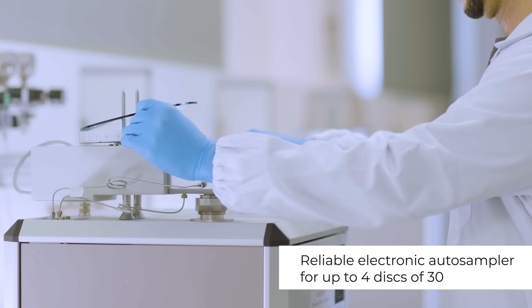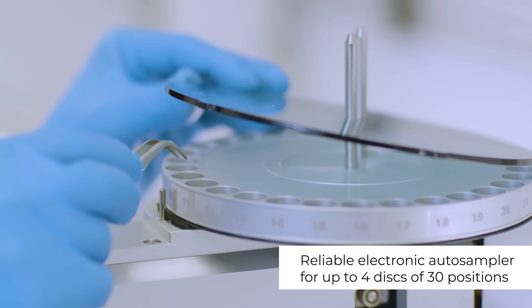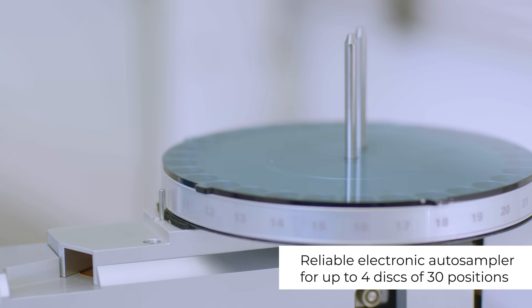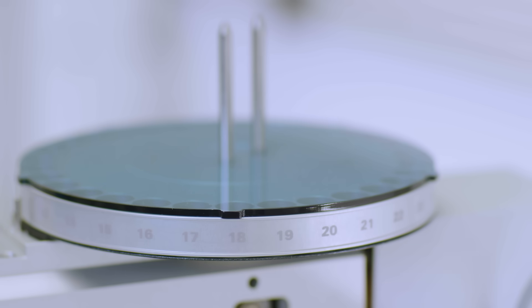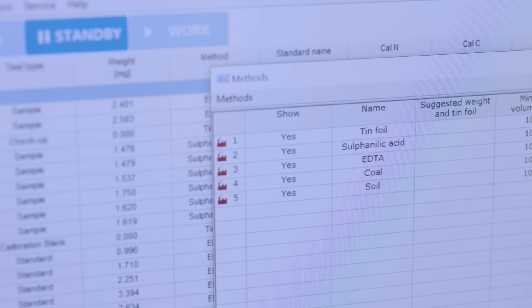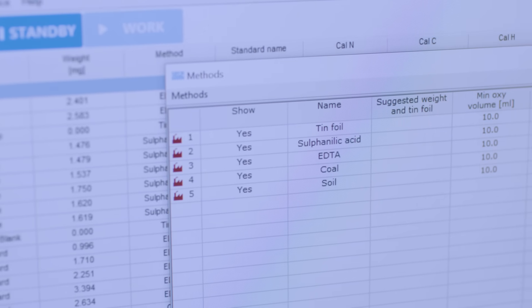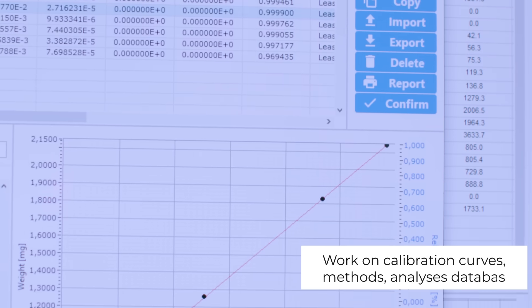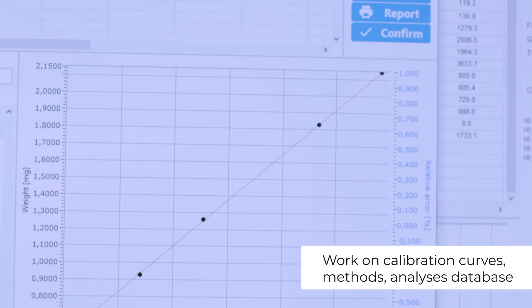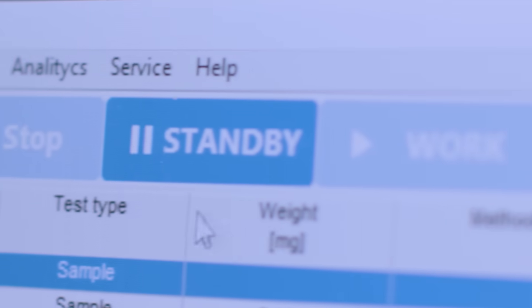The electronic auto-sampler ensures long-term reliability and can expand its capacity with up to four disks of 30 positions each to maximize lab productivity. Choose the analysis method from the rich library of pre-installed methods or make new ones customized to your needs. Create and manage calibration curves for any sample matrix. Select the samples to test and press start to begin the process.